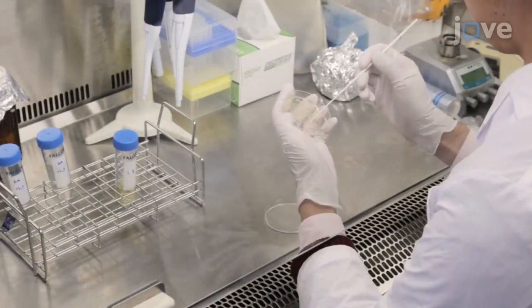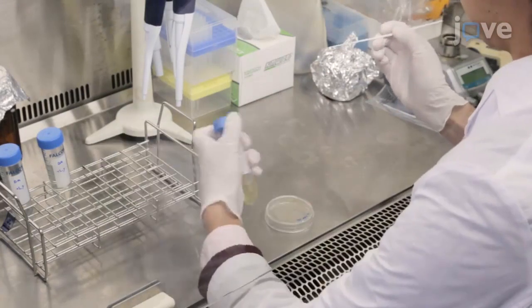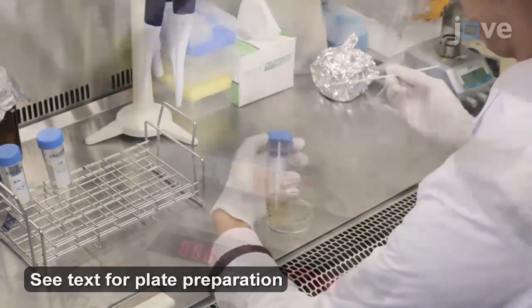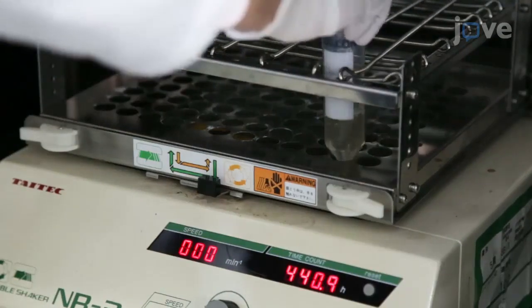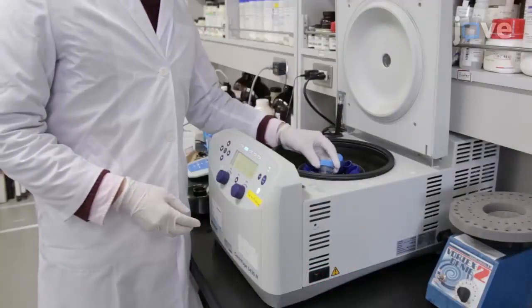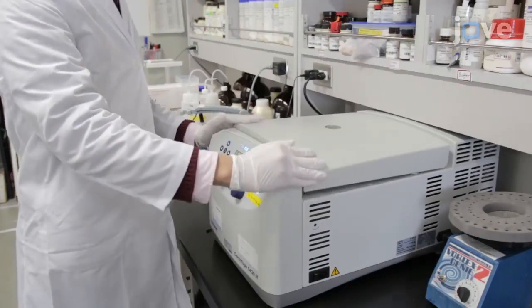To grow Shewanella MR1 cells, transfer one colony of the cells grown on an agar plate into 15 milliliters of LB medium. Grow the cells at 30 degrees Celsius for 24 hours in aerobic conditions with shaking at 160 RPM. Centrifuge the cell suspension at 6,000 times gravity for 10 minutes.